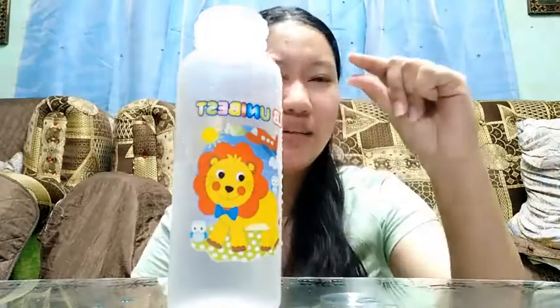So we've already got 150 ml. If you lack a little bit more water or chemical, you can use a pipette or a dropper to add very little drops of liquid.